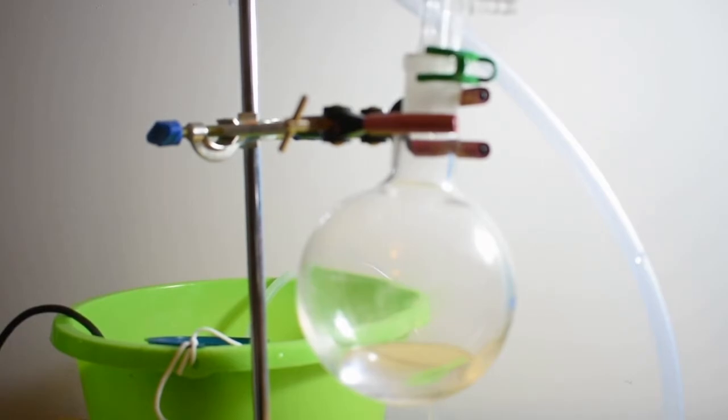Now that about two-thirds of the solution has been collected as distillate there's still some impurities in it and residual ethanoic acid and ethanol, and to remove those I have to transfer the solution to a separatory funnel.